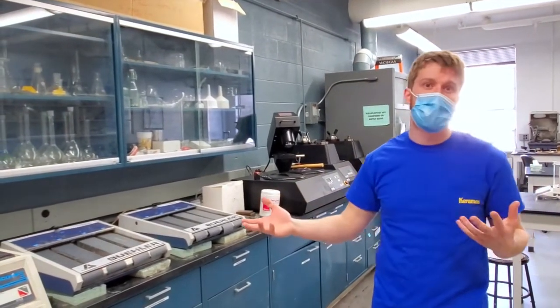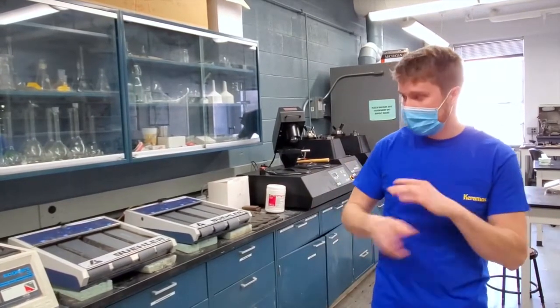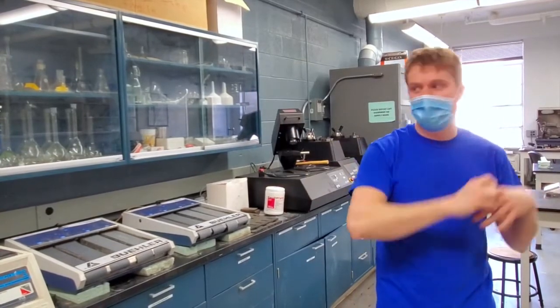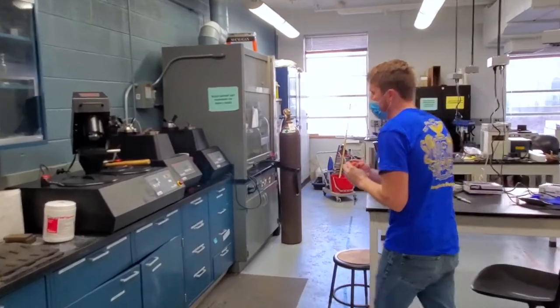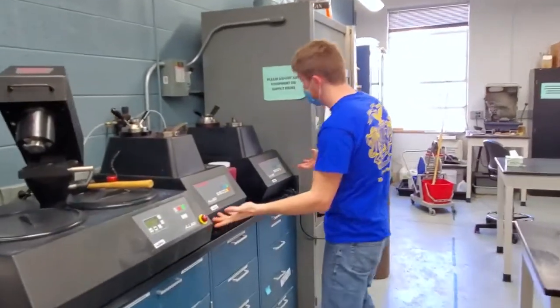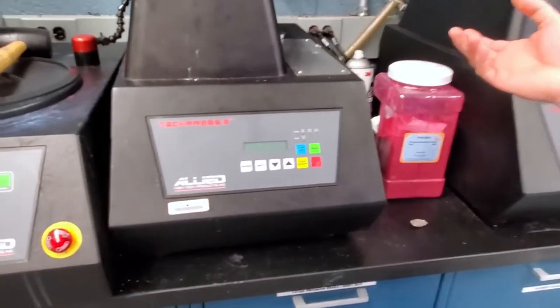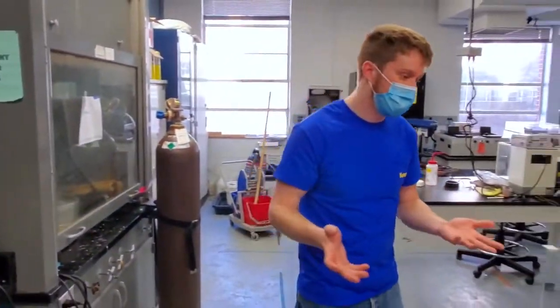Another thing it's important for is if you're doing electron backscattered diffraction, things like that, where you need to have a very reflective, smooth surface to capture what's coming off of your sample for analysis. Some of the other things we have here are these presses, which basically allow you to set samples into a polymer puck, and that can be useful for a number of reasons. One of the reasons is so you can use auto polishers to polish it instead of doing it by hand.